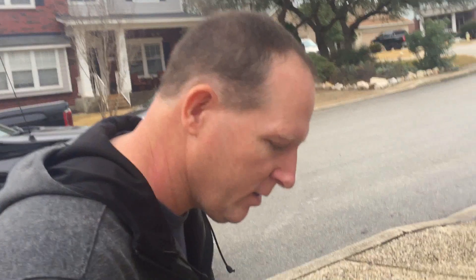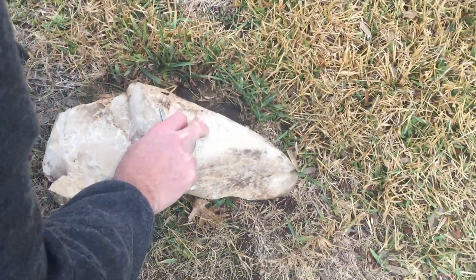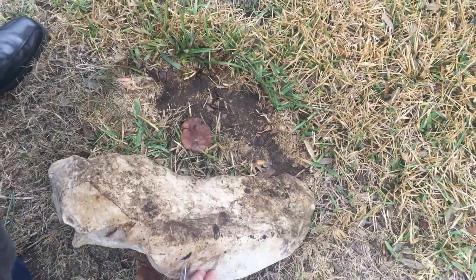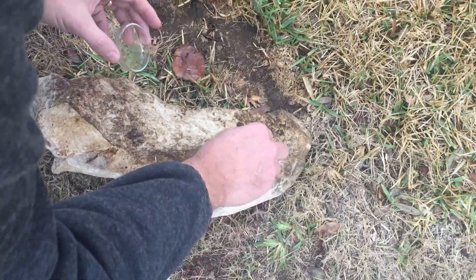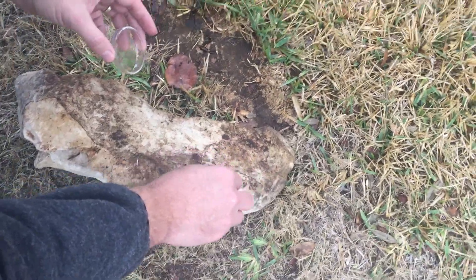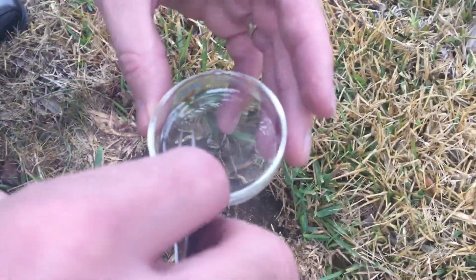Right here we're going to get some ants from under here because I remember seeing them here. There's one — there's some right there. See them? Let's see if we can get them. Come here. There you go.